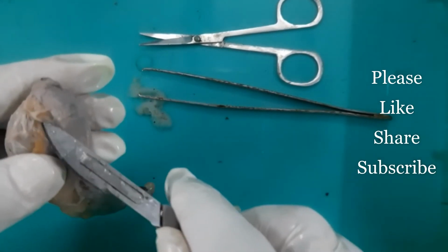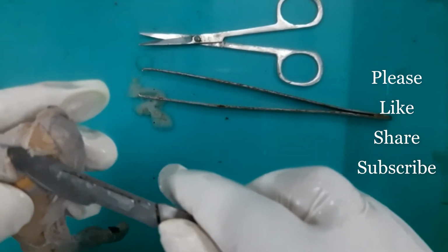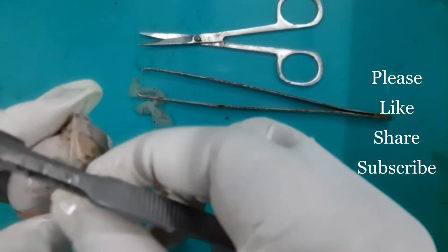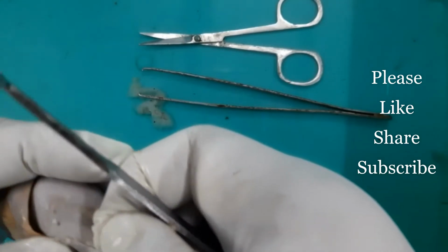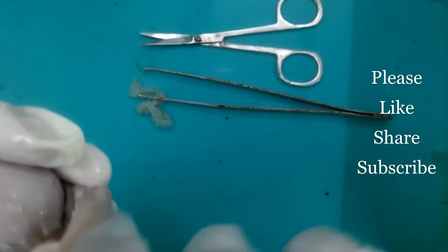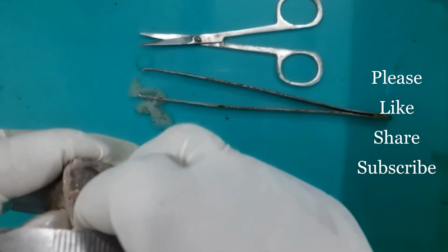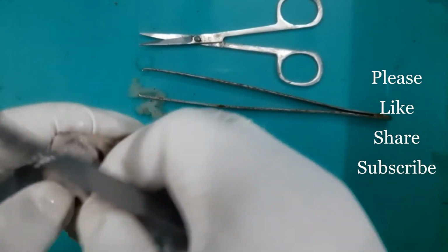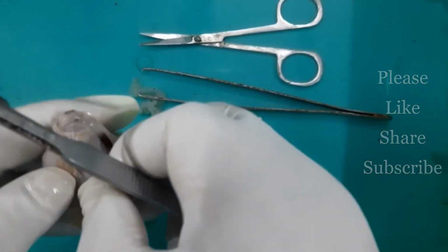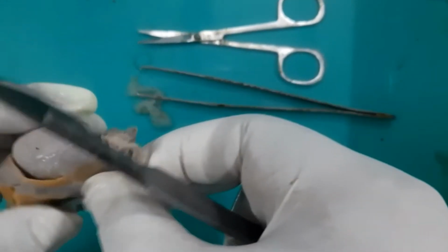I am trying to expose the tail part of the epididymis. Now, there are a lot of adhesions which are making it difficult to remove, because it is a closed serous sac, the visceral and parietal layer of the tunica vaginalis. They have also fused with each other. In a healthy testis, that should not be the case.